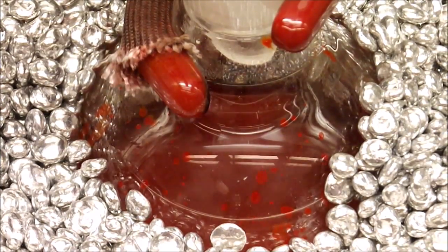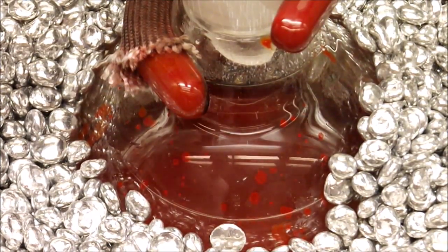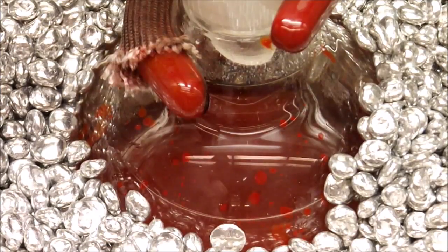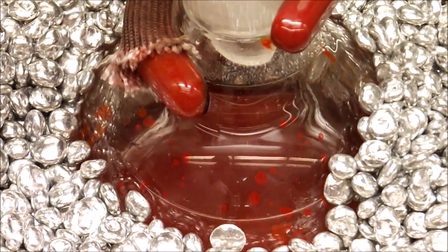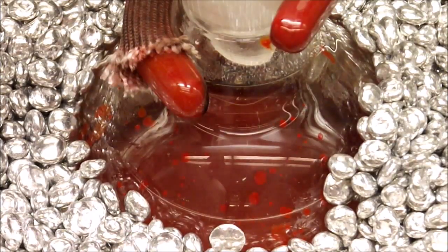Since this reaction is not at reflux, water is not required in the reflux condenser. Instead, the condenser is added to increase the headspace and was probably not necessary for this reaction.